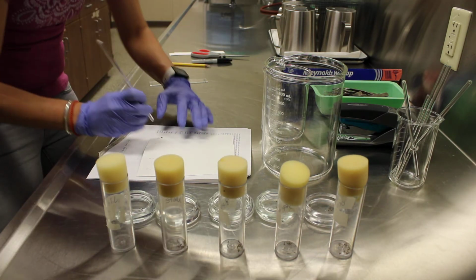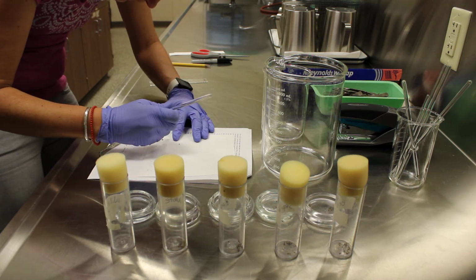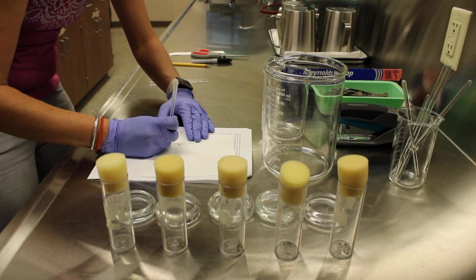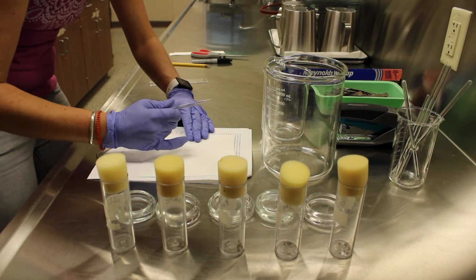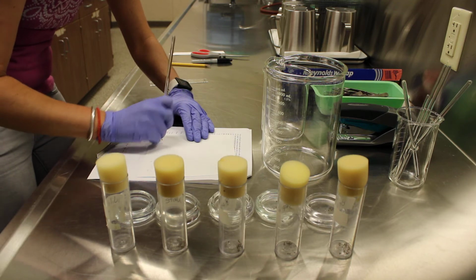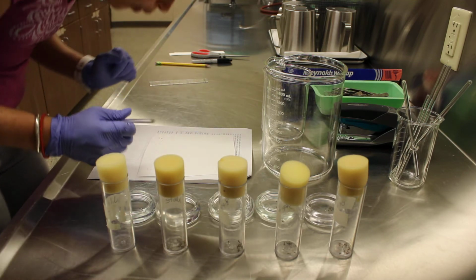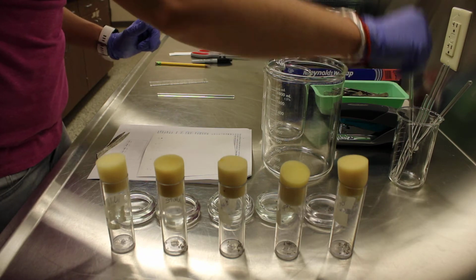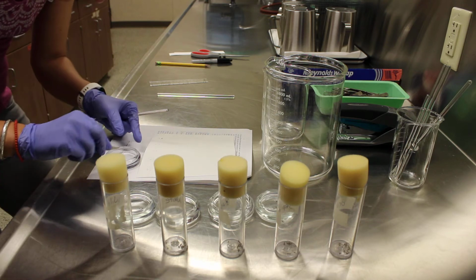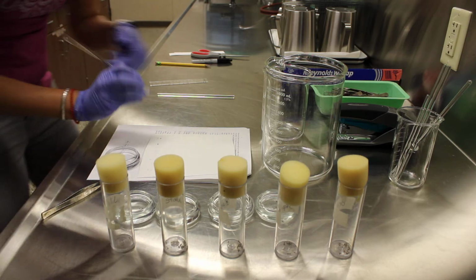So basically, I'm just trying to get a big clump of eye pigments from this fly on the paper. Let's move this guy back over here. Okay, so hopefully we got some pigments there. I'm going to switch the rods and move on to the brown. So I don't want to get any of those wild type pigments onto the brown tick mark.